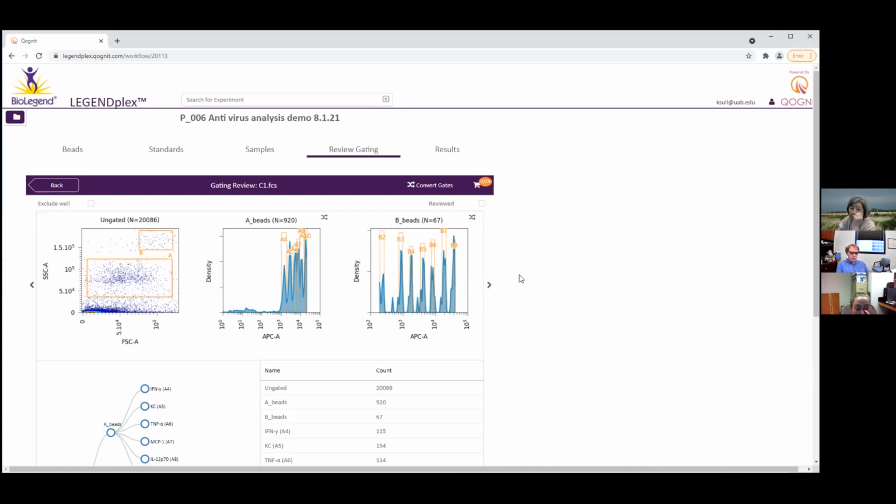So basically how this works is it gates on the A and B beads and then goes through and gates on all these peaks, which are the cytokine bead populations. The software does it automatically in the spots it's supposed to, but you see these little baby peaks here? That shouldn't be there. That's because we didn't have a large enough bead population, because this panel is pulling from the B beads, and look at how few B beads we have.